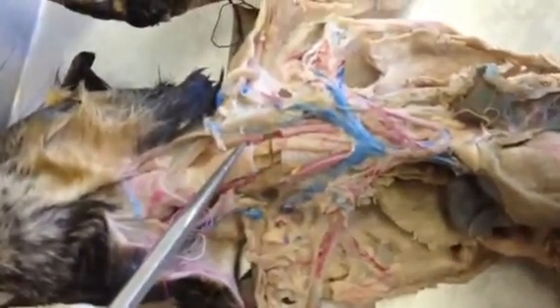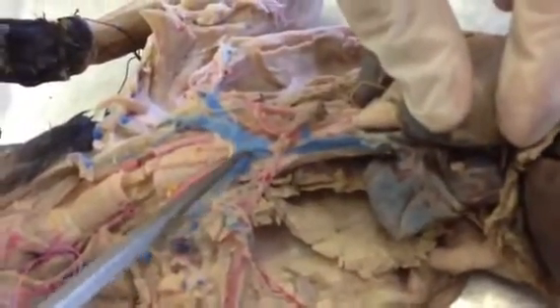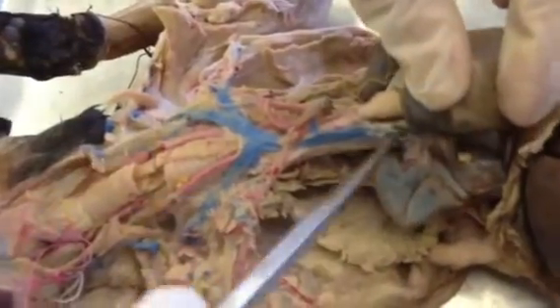All right, and then just over here, I told you this is the brachiocephalic. This is the superior vena cava, and that breaks into the right and left brachiocephalic veins. Off of the superior vena cava, if you want to go underneath here, see this? That's called the azygous vein. The big one, yeah, azygous vein.